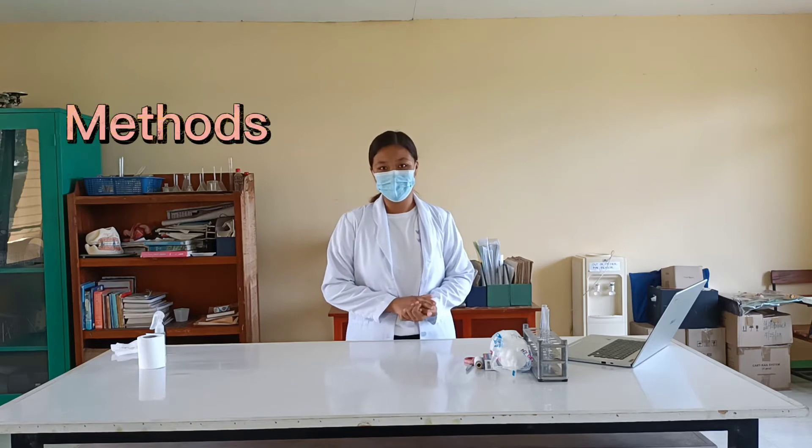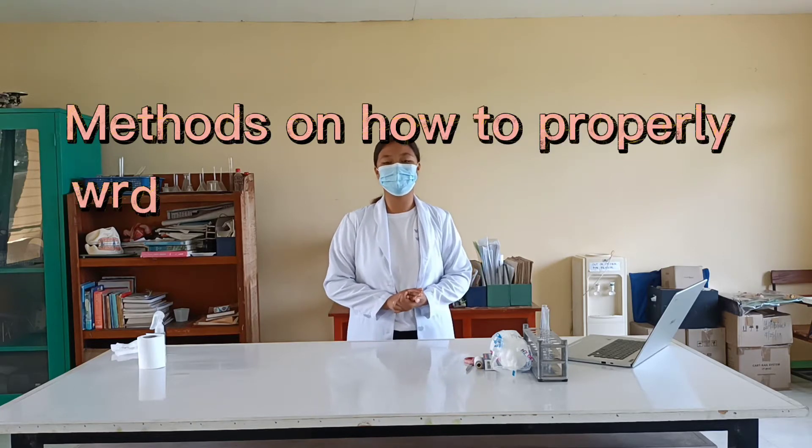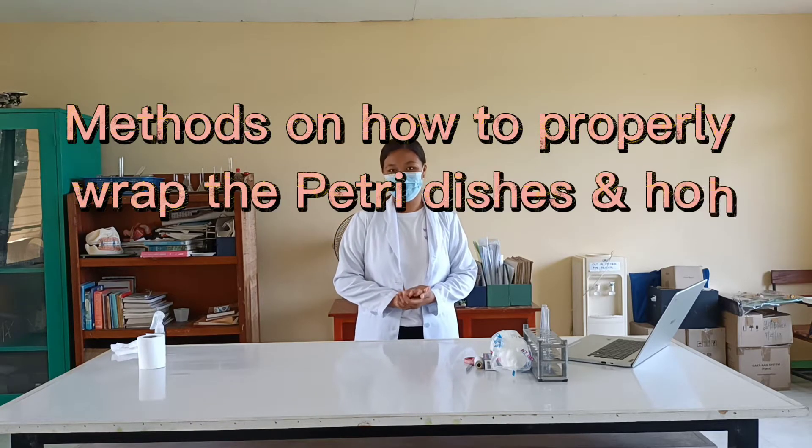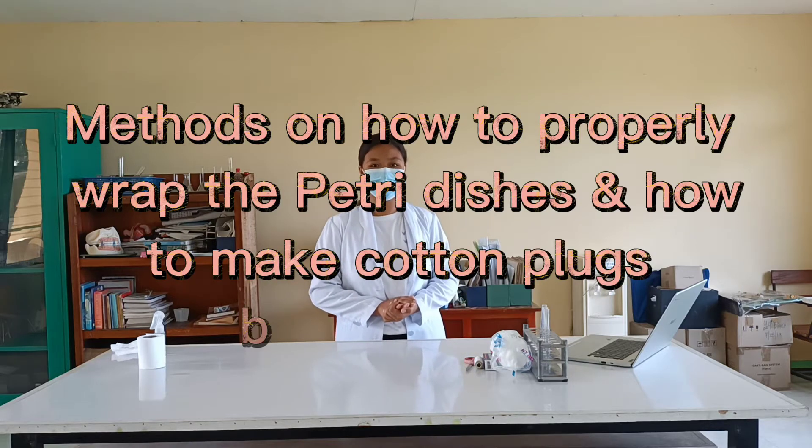Good morning! So for today's video, I'm going to show you the method on how to properly wrap the petri dishes and how to make cotton plugs for test tubes.